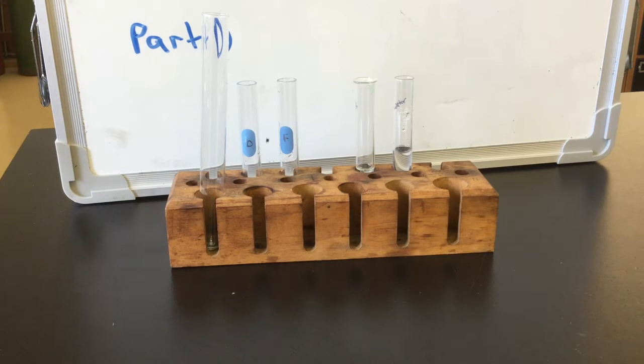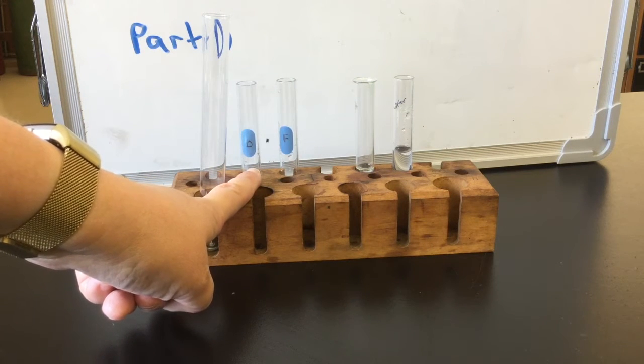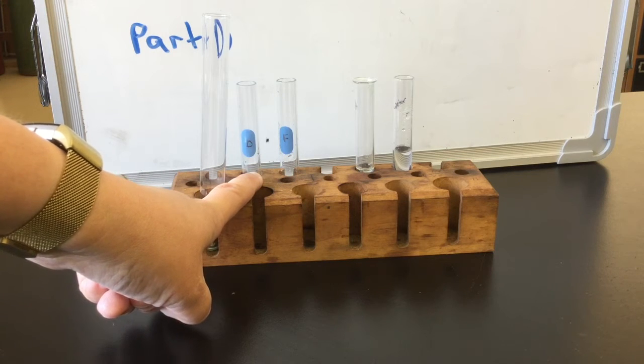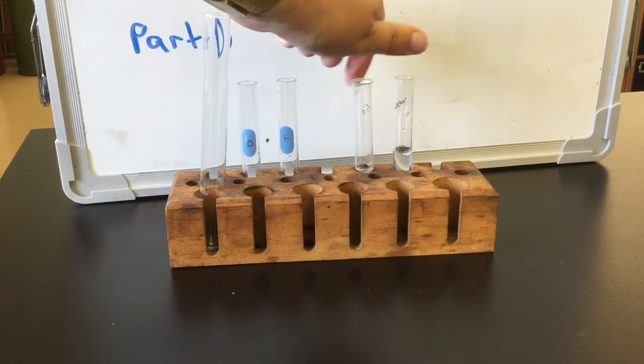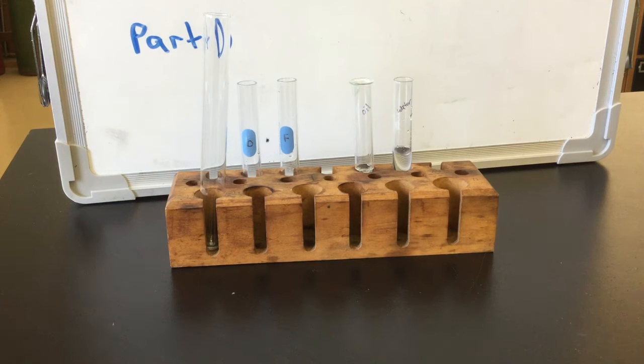When you set up your experiments that involve test tubes, D, F, and H, you will find that each test tube has a blue or white spot on it that you can write in pencil to label it and keep track of what's in it. Some of the test tubes that you have been given may not have these. In this case, you may use a Sharpie to write on the test tube itself what the material is. But you'll need to make sure that you ask your TA or your instructor how to remove this ink so that the next time the tube is used, it can be labeled as something different.